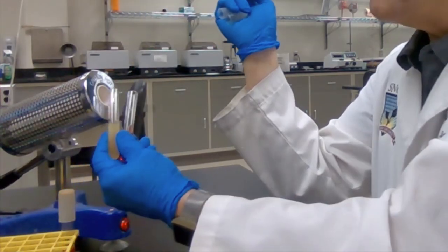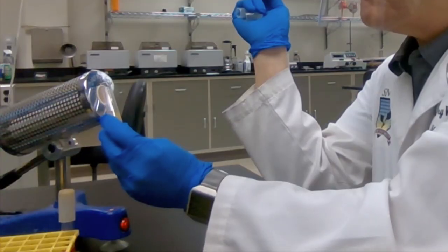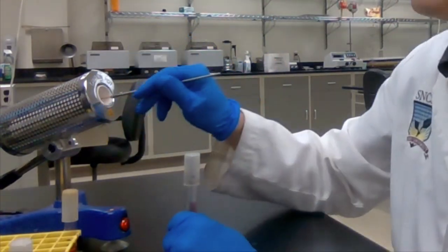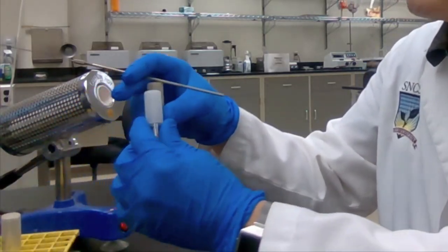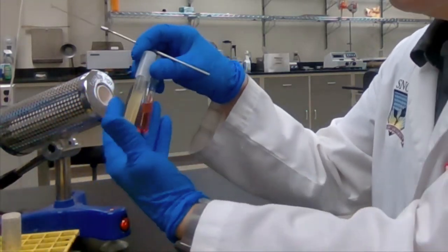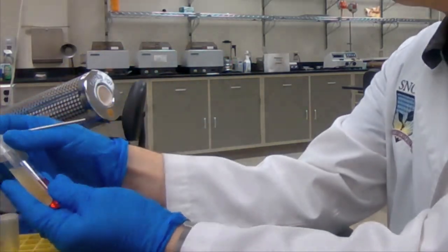Then the mouths of the tubes are again flamed and the caps are replaced. The inoculation tool is sterilized. Skilled microbiologists have a routine for doing this and can make a tube-to-tube transfer in less than 30 seconds.